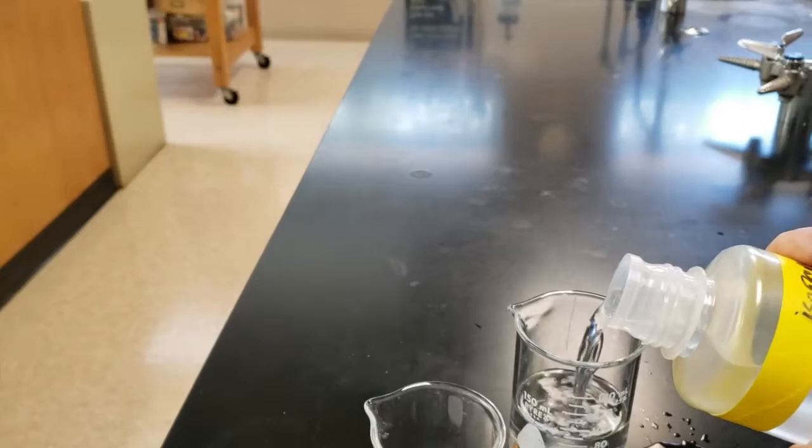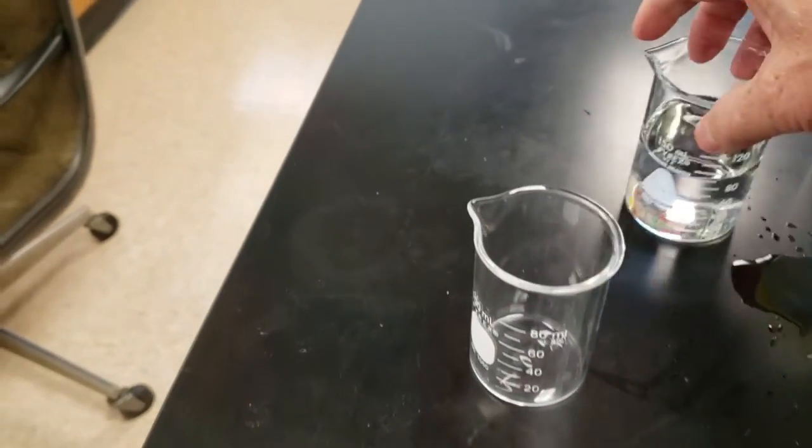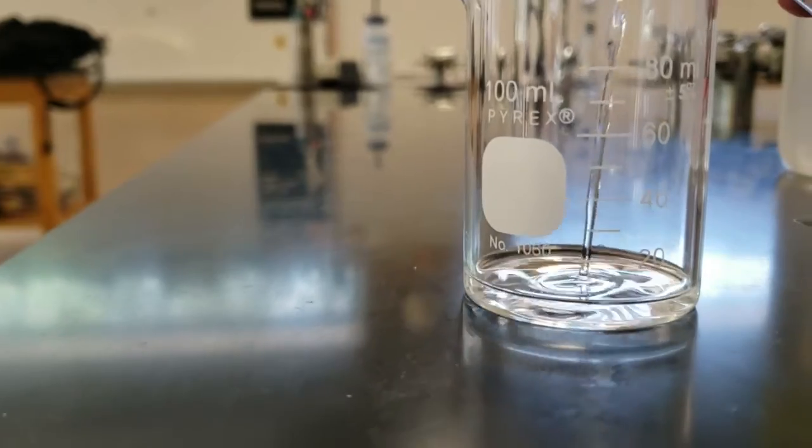Oops, spilled a little bit. So I'm just going to have kind of a reservoir for stuff to use right here because everybody can't have their own bottle. We're going to pour it in there until it measures 20 milliliters.